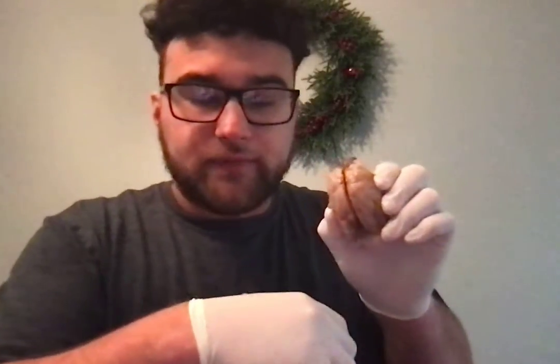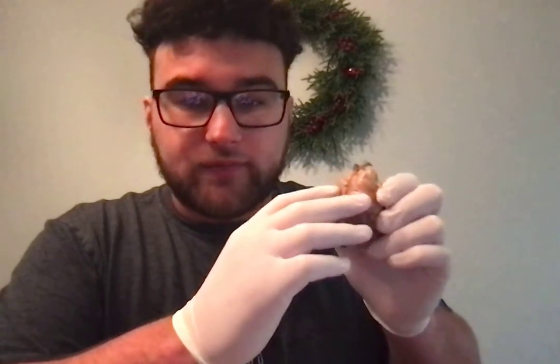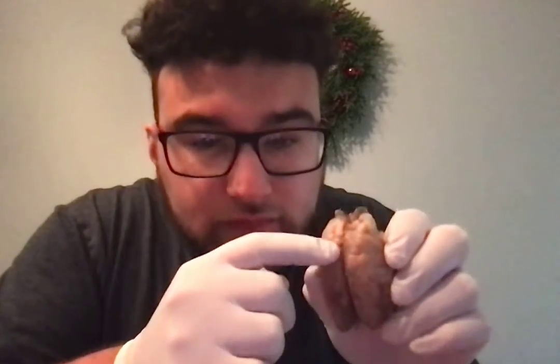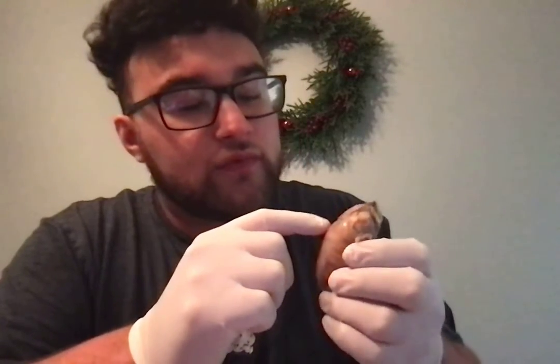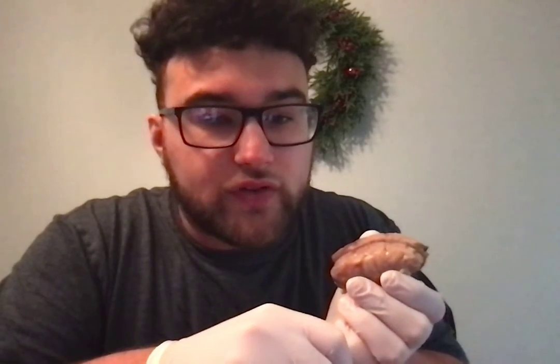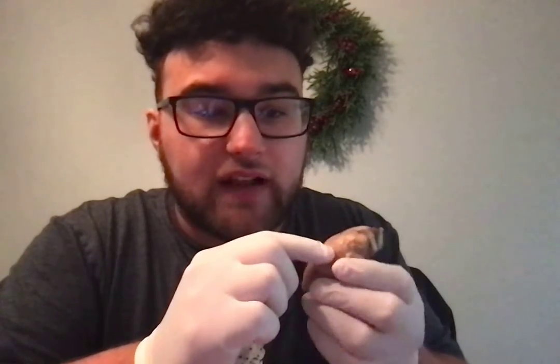The ridges are the gyri, and the black lines running along the brain are grooves called the sulcuses. So whenever you look at the brain, what you're seeing is the gyri and the sulcuses.